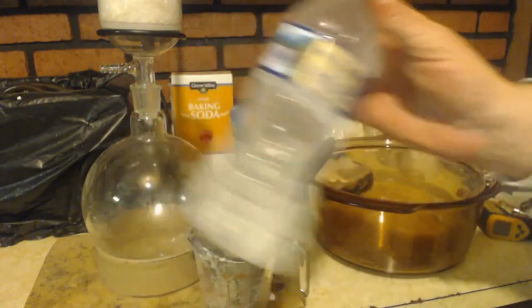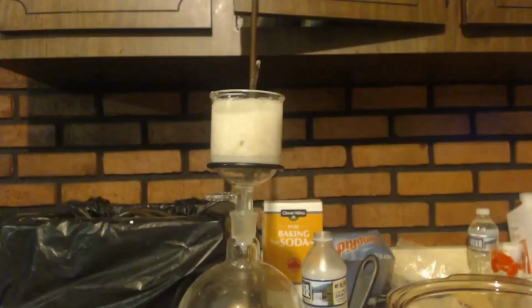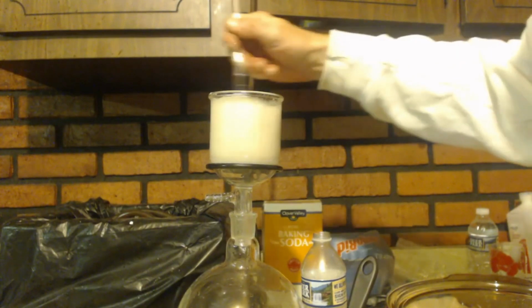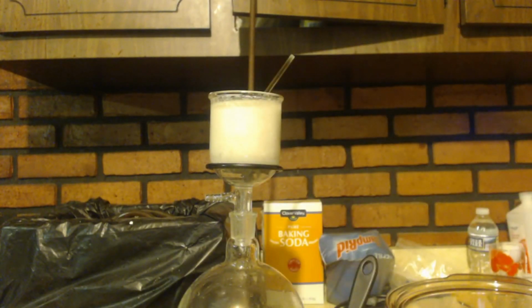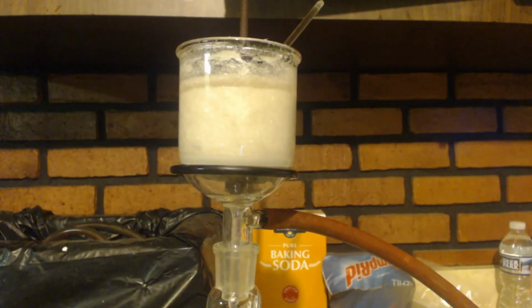So I got some ice cold water. I'm going to try to get some of the stuff out of here and then wash this. And then I'm going to stir this up while I do this. Get anything that's in the middle. You can see it's kind of brownish in the middle there. Now I'm going to put this back in the freezer. I'm just going to let that gravity filter out while I stir it. Alright, so after stirring that for 5-10 minutes there, I'm going to suck it down with the vacuum pump.